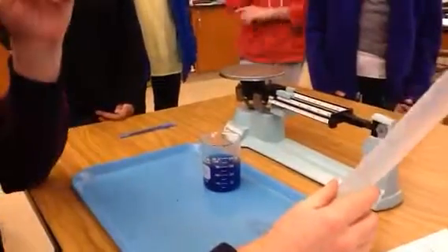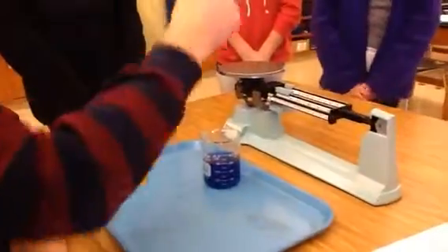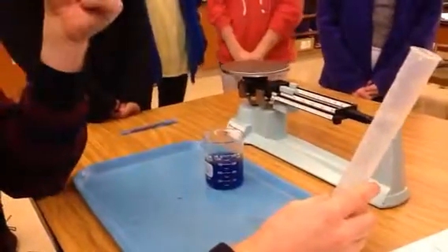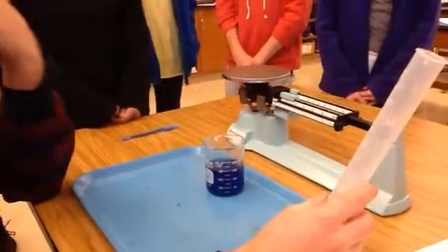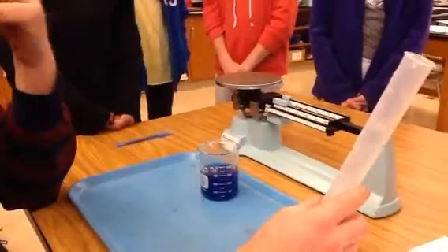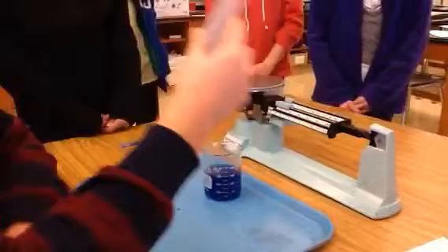Density of water. We're going to see that if we put different amounts of water in here and measure them, if they come out to be the same or different. That's like the whole goal of this lab. This is different than doing the density of solids, where volume was kind of a pain in the neck because you had to do length, width, or height, and water displacement. Today, volume's going to be the easy one, because all you have to do when you're measuring a liquid is pour the amount in, and you're done.